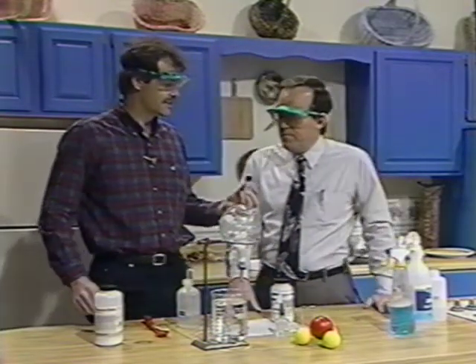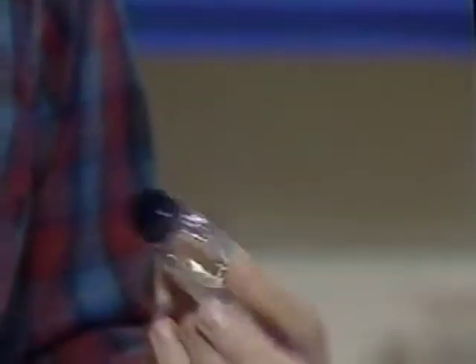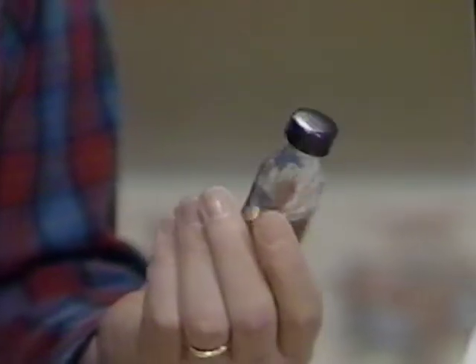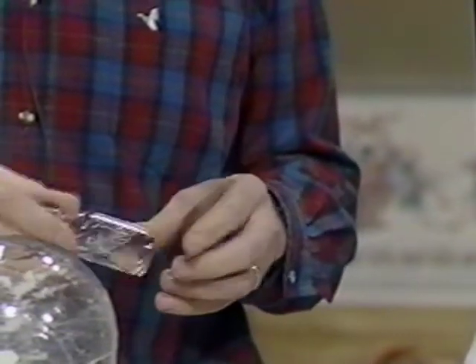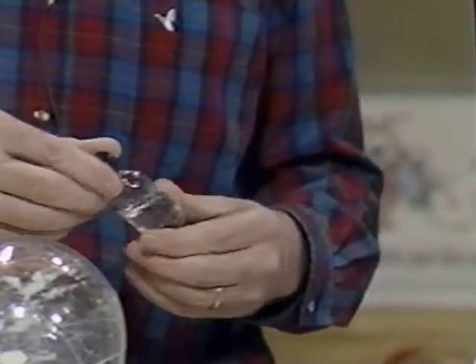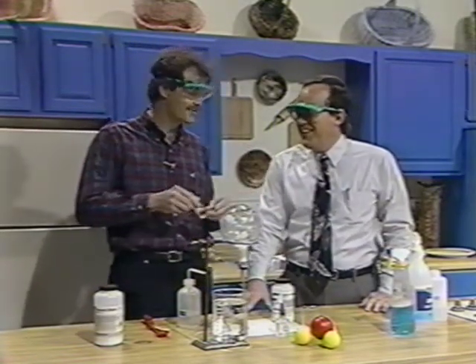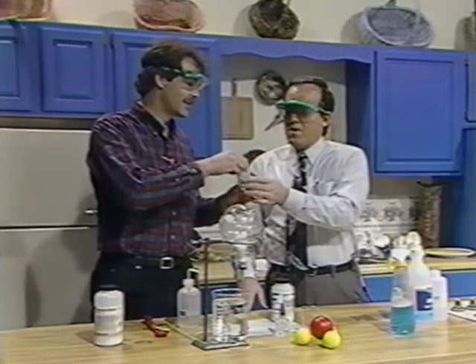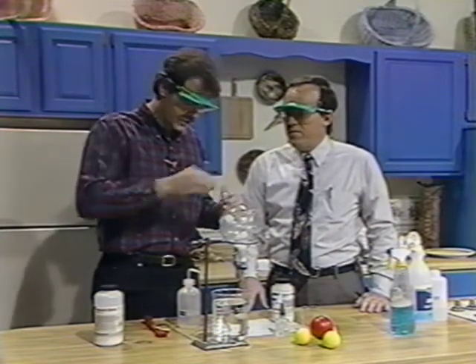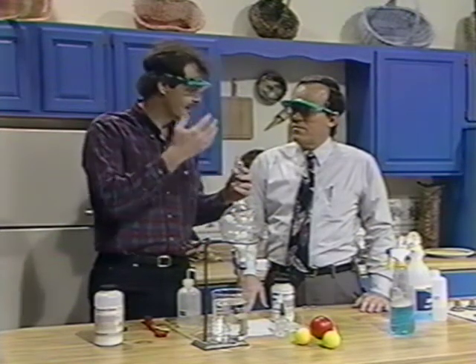This is a solution of ammonium salts — like smelling salts. People commonly use this if someone faints. I got knocked out playing football a time or two and they waved this under my nose. Now, I want you to demonstrate this for us, but be careful. Whenever you're going to check the odor of a chemical, you never stick your nose up there and inhale.